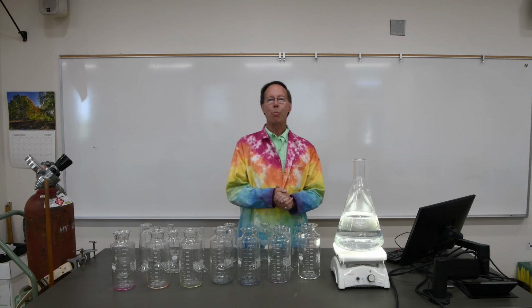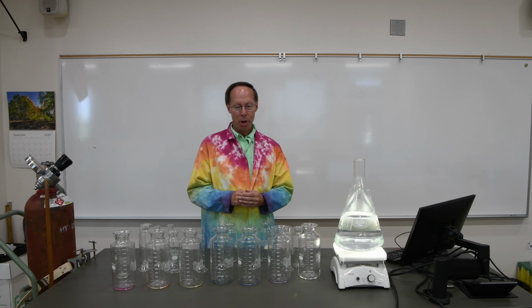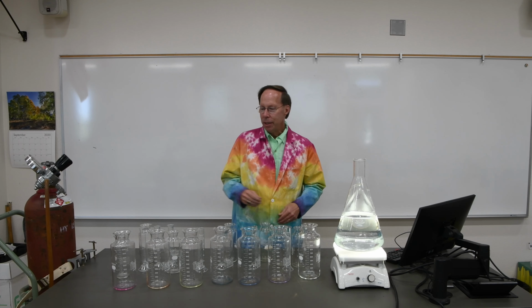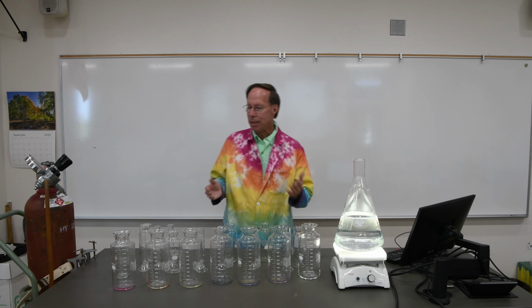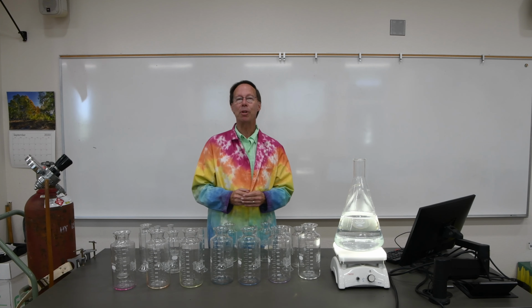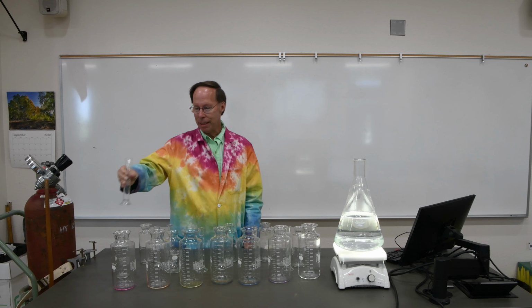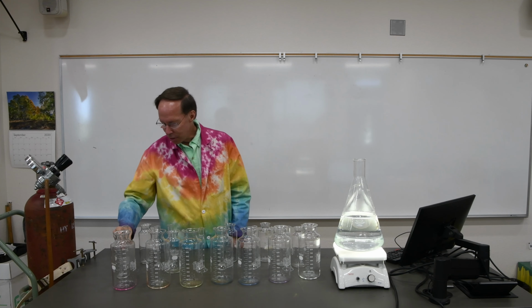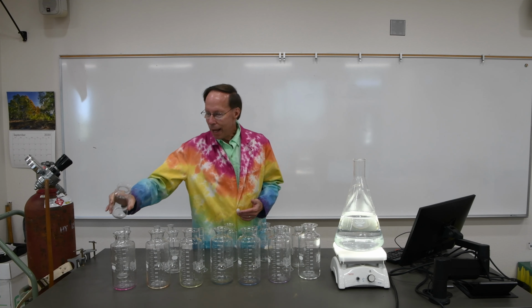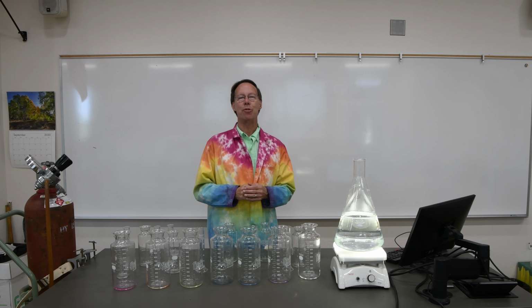Now, for you chemistry students, of course, you're probably wondering what happened here. Well, in Chapter 5, which is coming up in a few weeks, we're going to be talking about acids and bases. And acids and bases will cause certain kinds of chemicals to change color. In each of these first 6 beakers, I had put an indicator. And each of those indicators happens to be colorless in the presence of acid, but they change to a lovely different color if you add a base. When I added the chemical from the graduated cylinder, it contained sulfuric acid. So it made each of the indicators in the beakers acidic, and in that case, they're all colorless. In these smaller beakers, I had sodium hydroxide, which is a base, and as soon as we added enough of the base to the flask, it neutralized the acid, the solution became basic, and those lovely colors appeared.